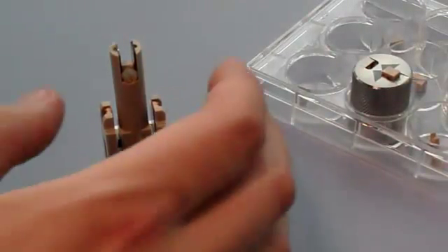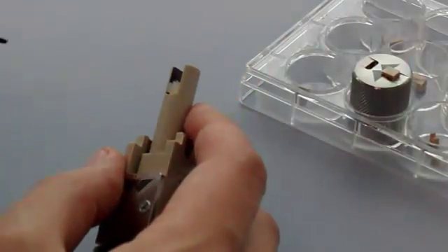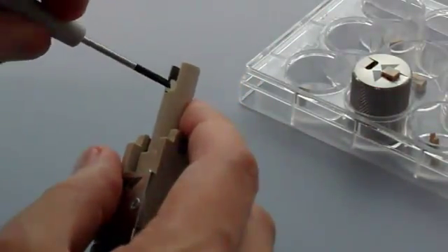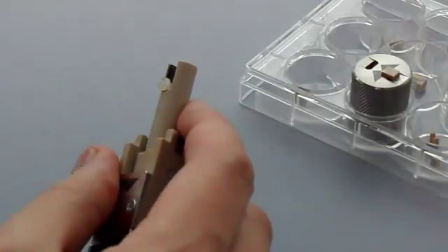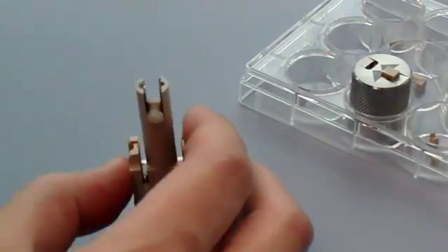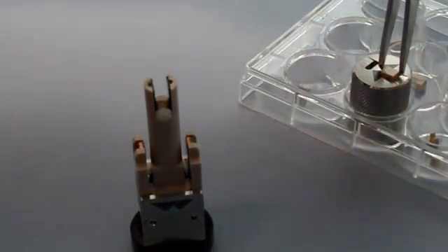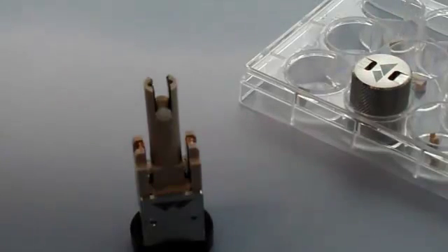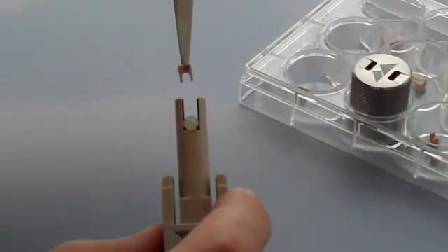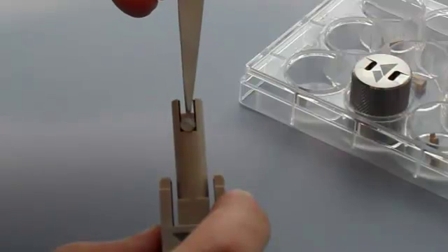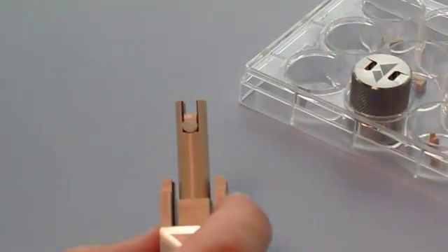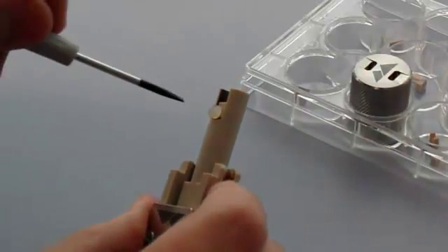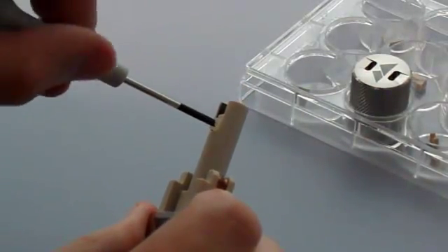Once the glue has dried and the sample has been secured, the sample holder must be fitted to the cell. The sample holder fits at the end of the cell barrel in between the two electrodes. Using the screwdriver provided, loosen the screw at the bottom of the barrel. Then using the forceps, position the sample holder so that the legs of the holder are either side of the screw, which will hold the sample holder and thus the sample in place between the electrodes. Tighten the screw so that the sample holder is held securely in place.